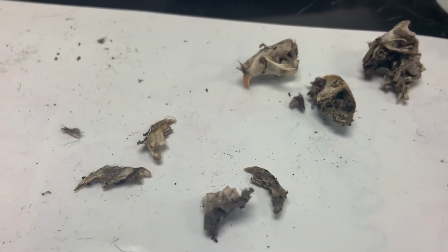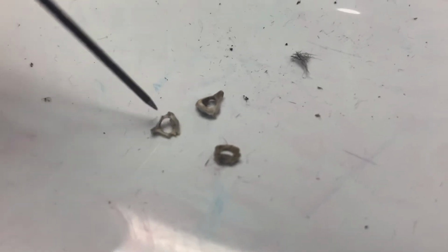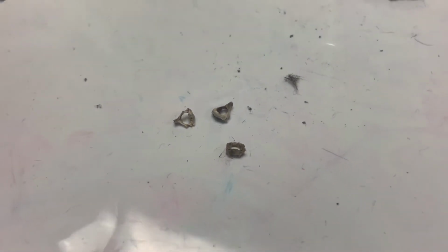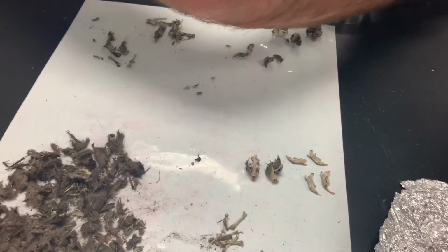The one thing that I found that Mr. Underwood didn't find are these cool little things. I don't know if you can see them really well, but these are actually individual vertebrae, and we can look at those too. If you don't remember what vertebrae is, it's your backbone, right? So what we're going to do is try to compare some of these to find out what we have, and we just clicked out of it, so I got to go back. Sorry, guys.